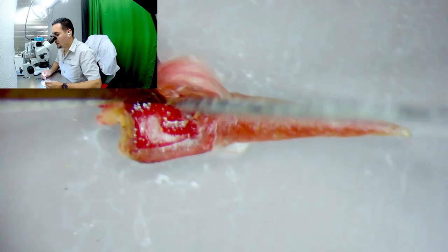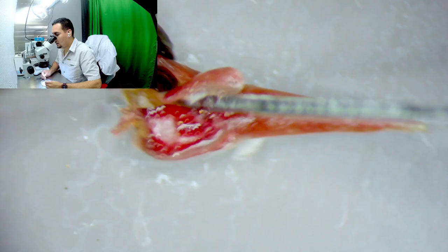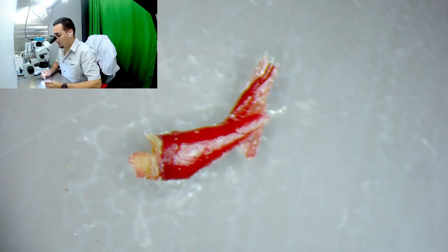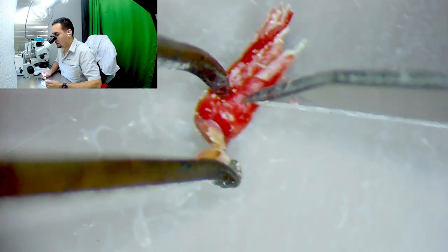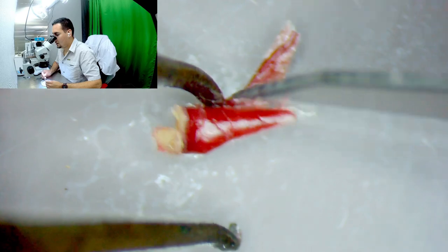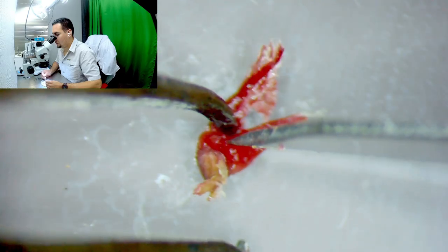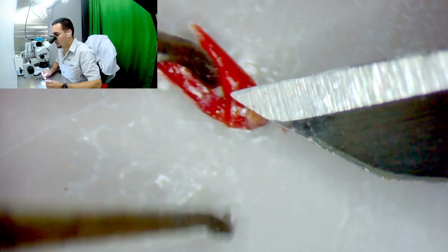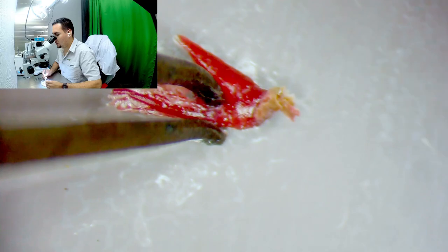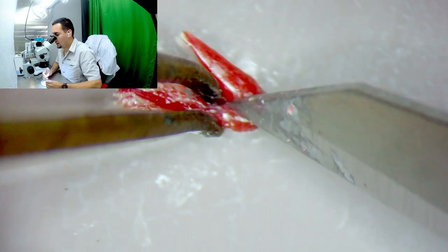You have to have patience — this is definitely not easy. I was very impressed with all of you who got really far into removing many leaf primordia. It's definitely not easy. You can see the leaf, and my apical meristem is right here in the middle, so I want to cut this part and get rid of this.